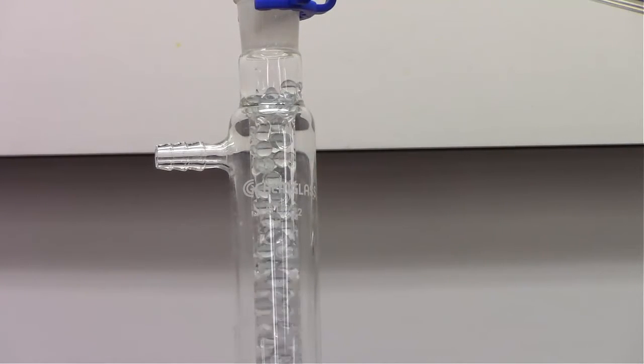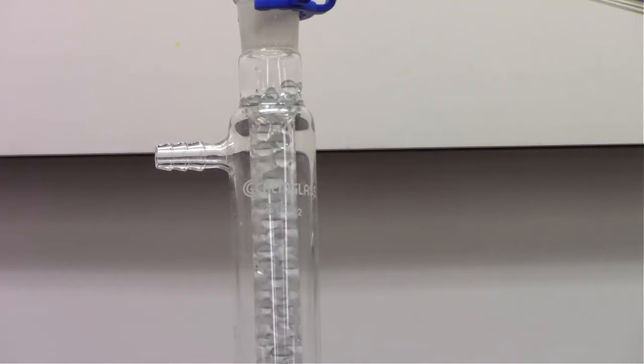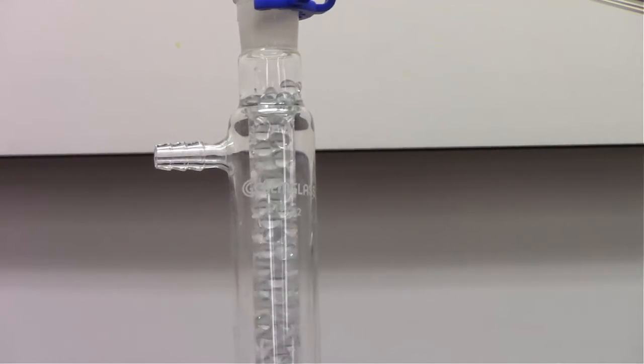We're just about to reach the thermometer, where our lowest boiling point solvent is. It's going to start being collected in the condenser.